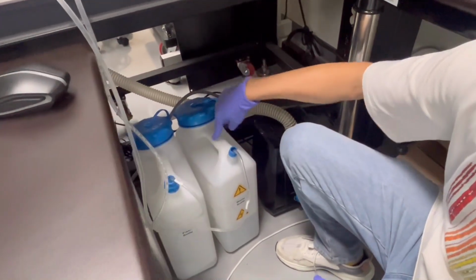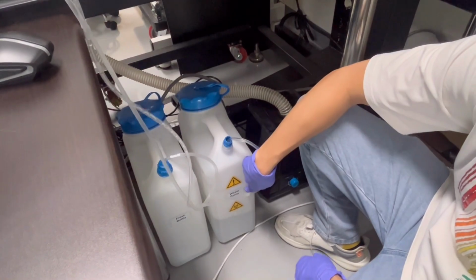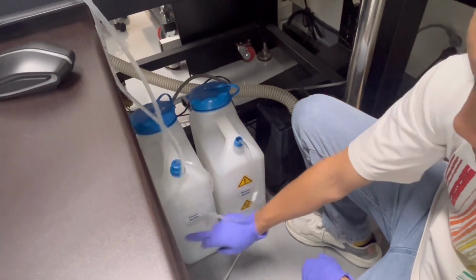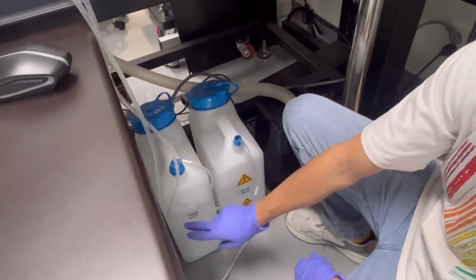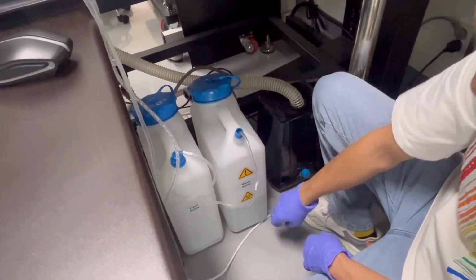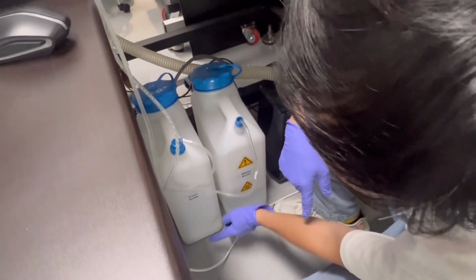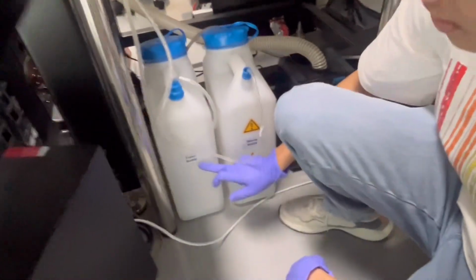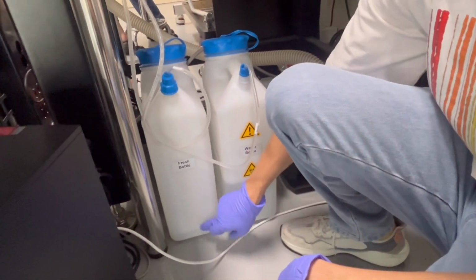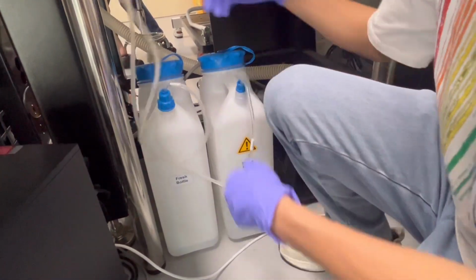In here we have the fresh bottle and waste bottle, so we always keep the water in the middle of this bottle. And this one we can throw out, or we can contain a little. So we have to check the water level. Like this one, it means it's very low on water, so we have to fill it.